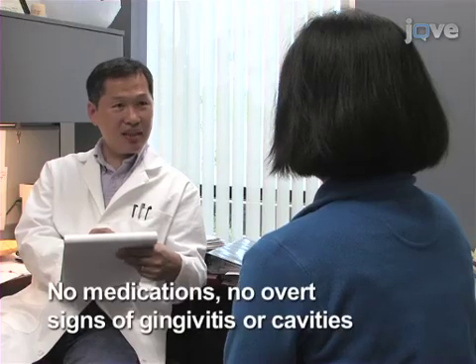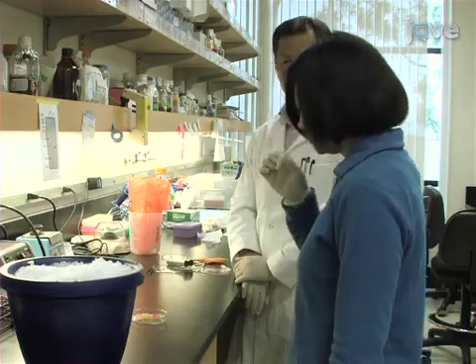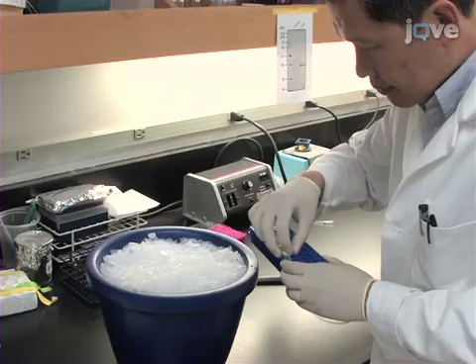Recruit healthy 20 to 40-year-old volunteers. After an oral rinse with water, ask the subject to spit whole saliva samples onto an ice-cooled vessel. Pool all samples and store on ice.